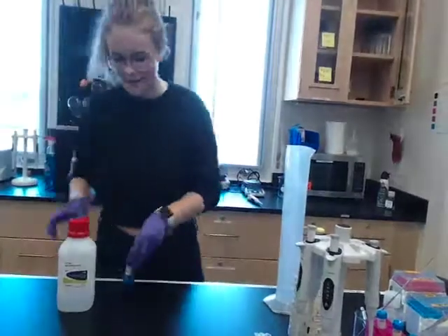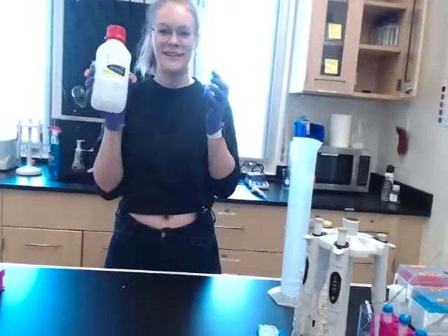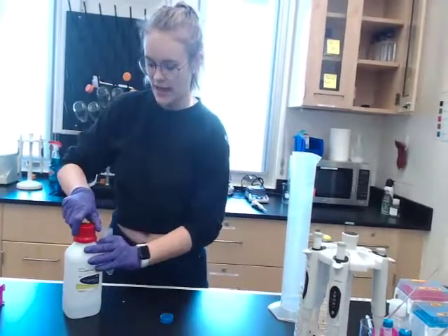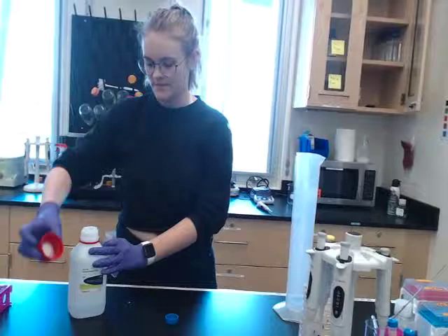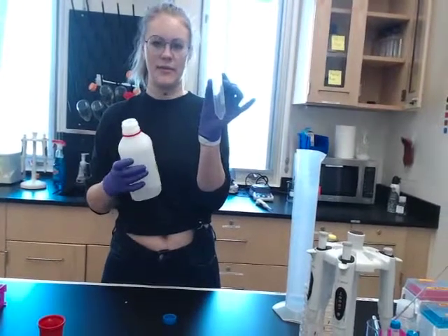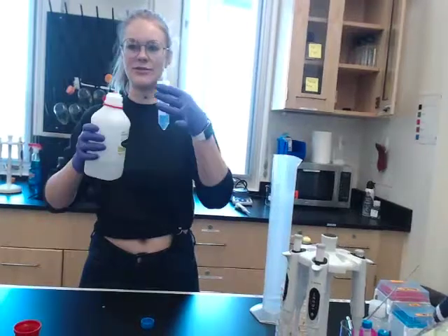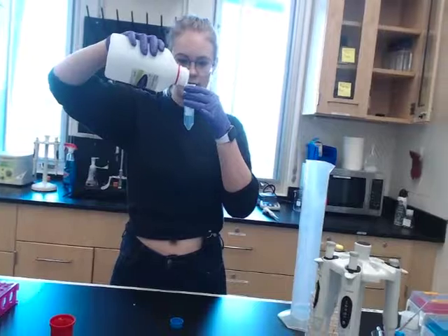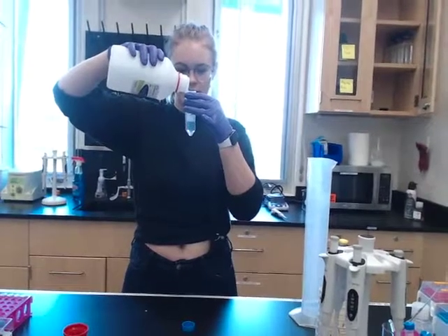So before I go, I need to refill the aliquot for 20 ml of the 50X TAE. All you do is pop the cap off of both of these. Keep the measurements pointed towards yourself so you can see how much you're actually pouring. And then you're just going to go ahead and pour up to 20 ml.